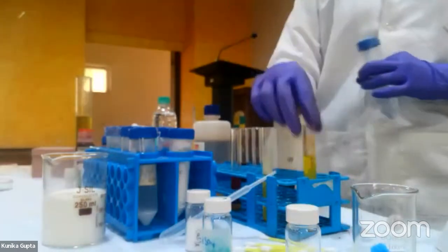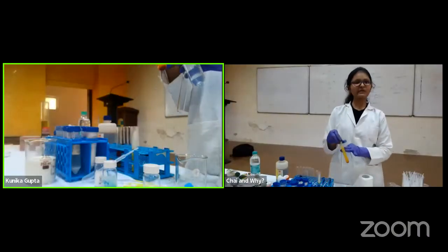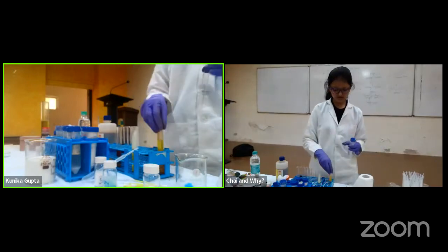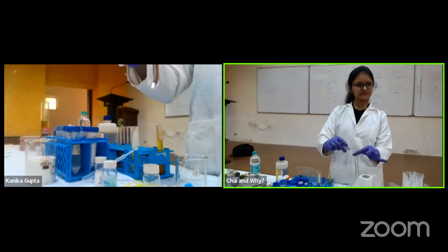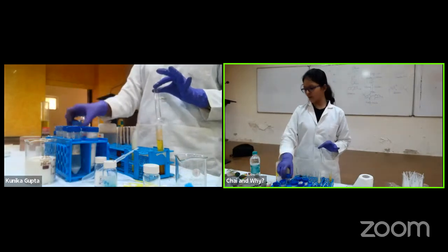Okay, so you have seen in my case with the fluorescein here, this does not dissolve. So this experiment is generally done in methanol, which is also water soluble. But as I told you, we forgot to bring the methanol. So here I am taking DCM. I have added it. Okay. Now I'll add pyrrole to it.